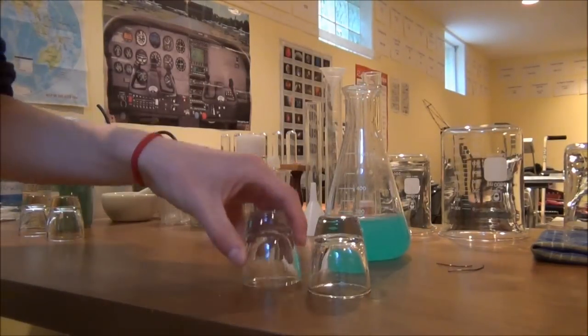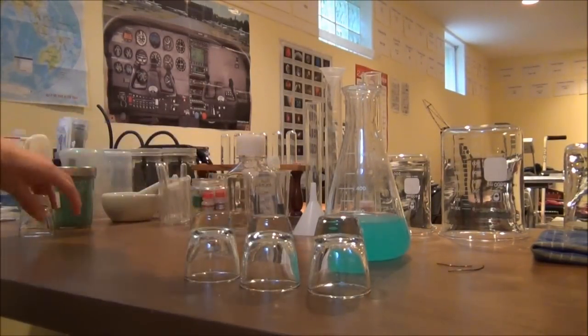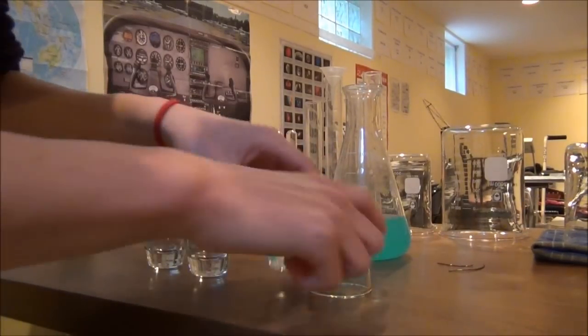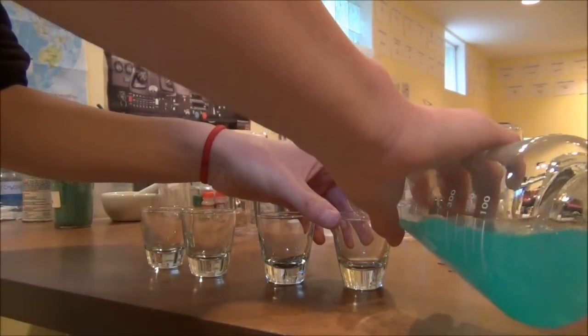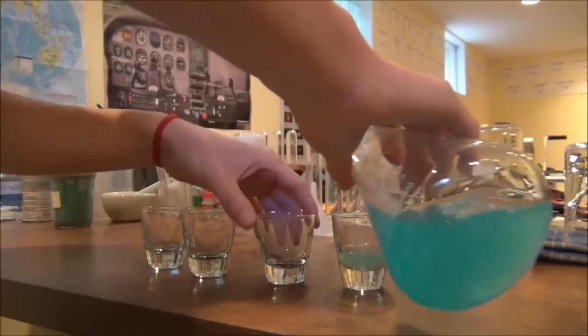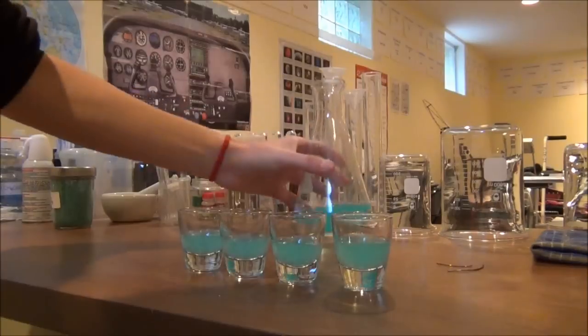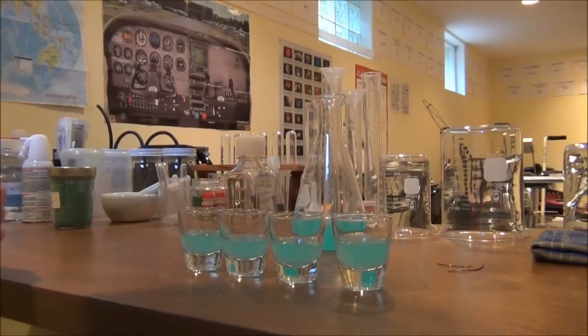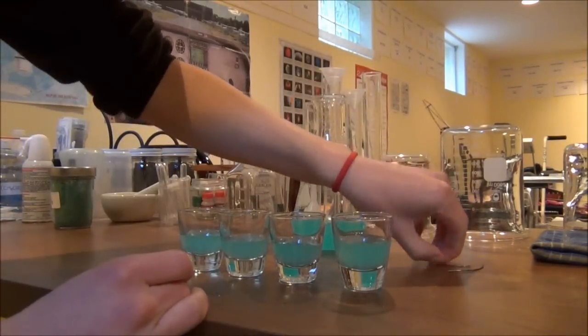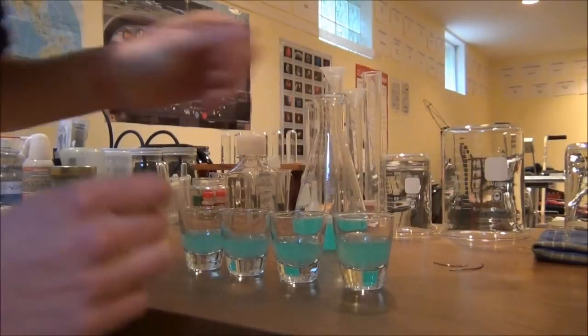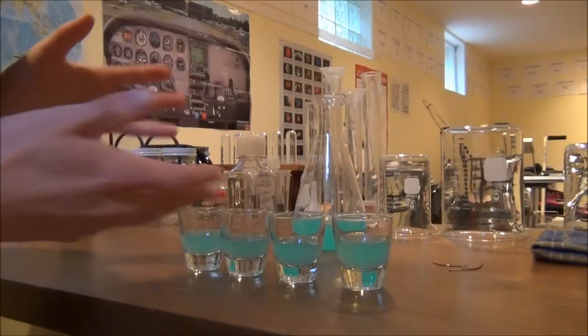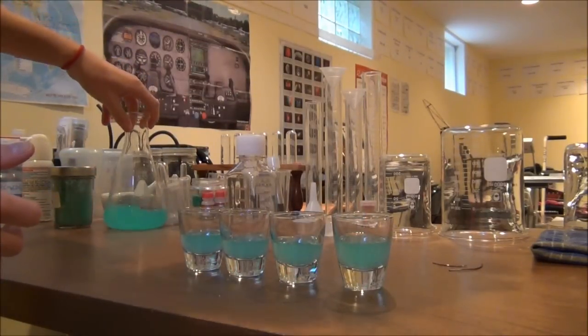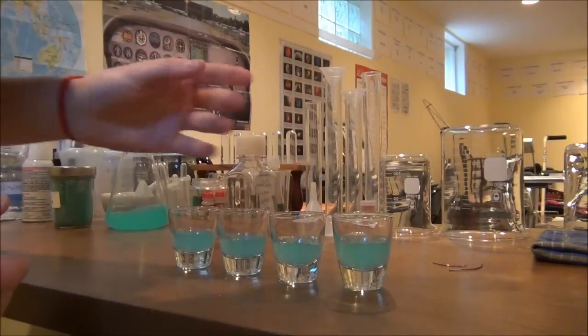All right now I'm going to finally put these shot glasses to use. I'm just going to portion a little bit of the copper 2 sulfate in each of these glasses and try to keep it even here. Look at that, perfect. And now what I'm going to do is take four different metals and I'm going to place these into our glasses containing the copper sulfate solution.